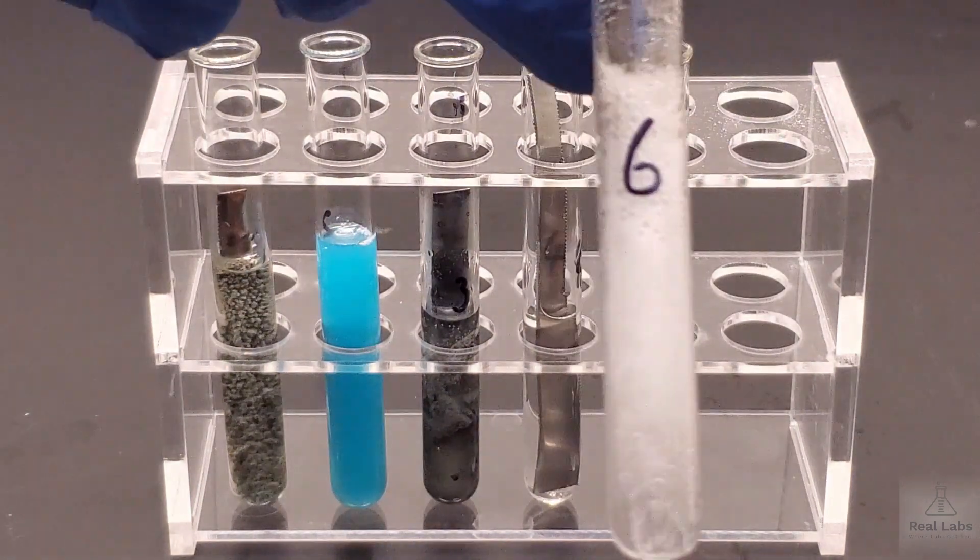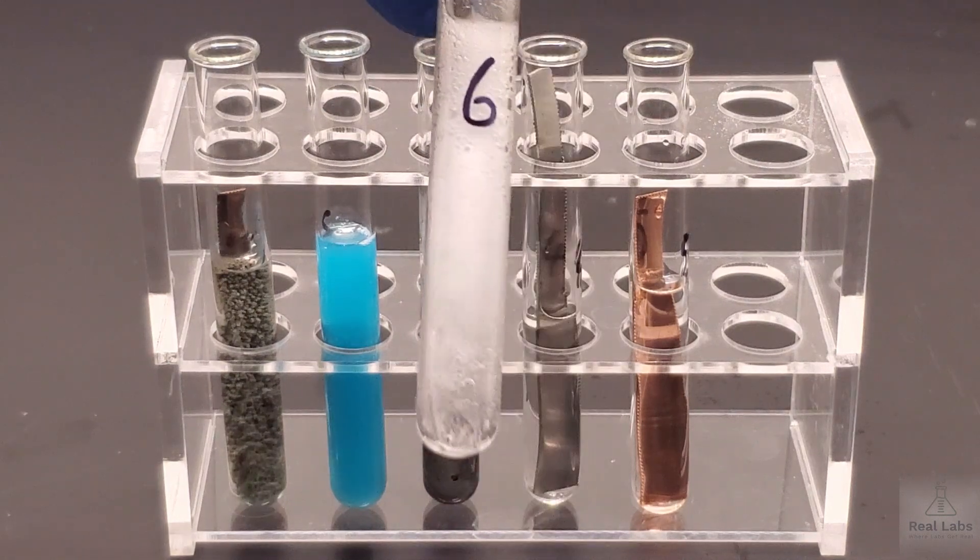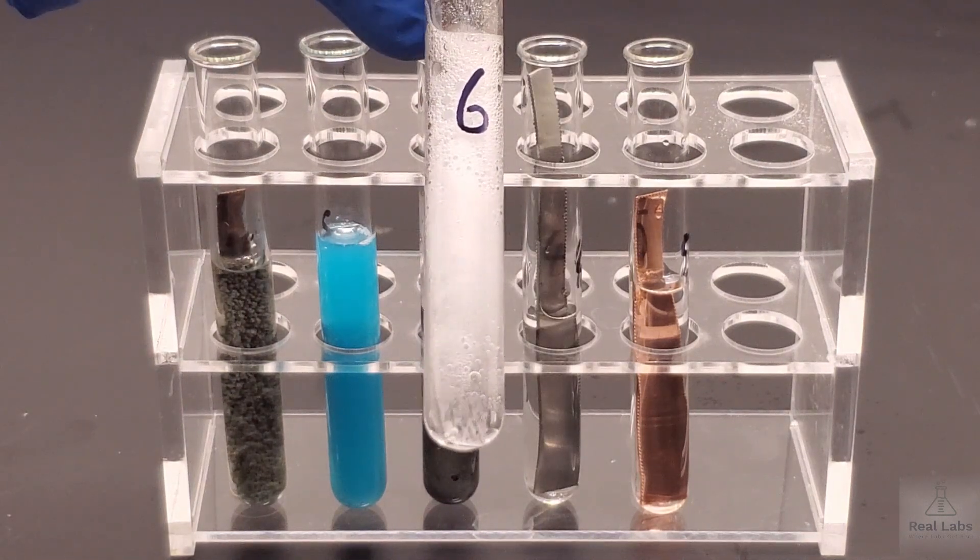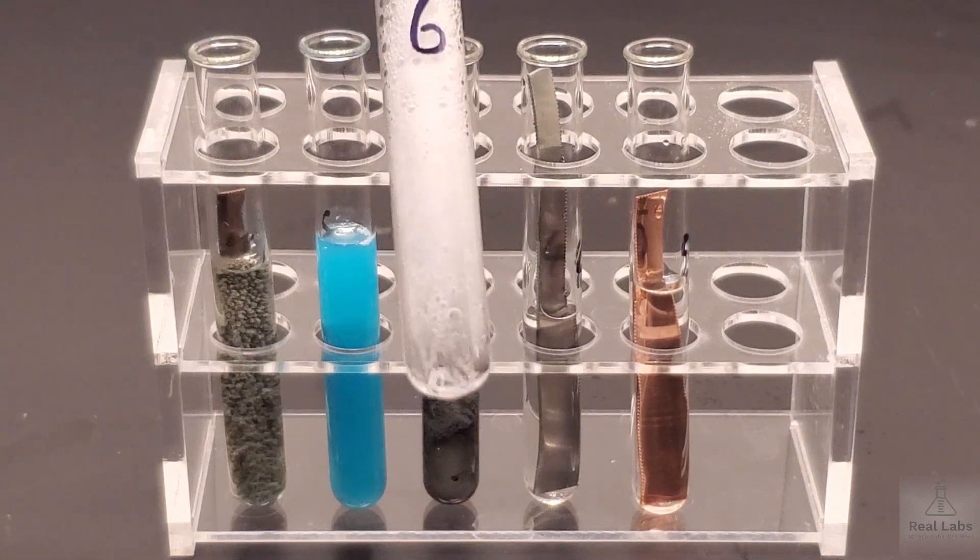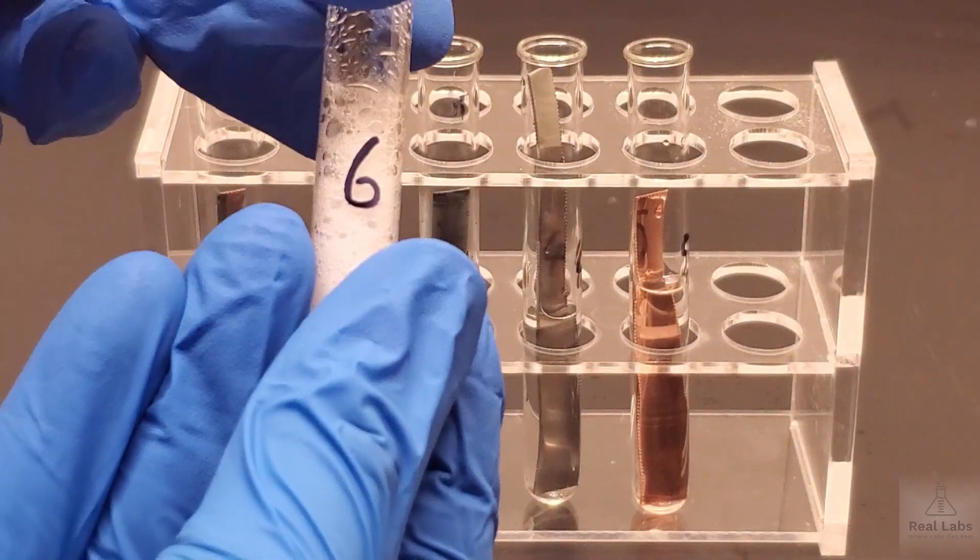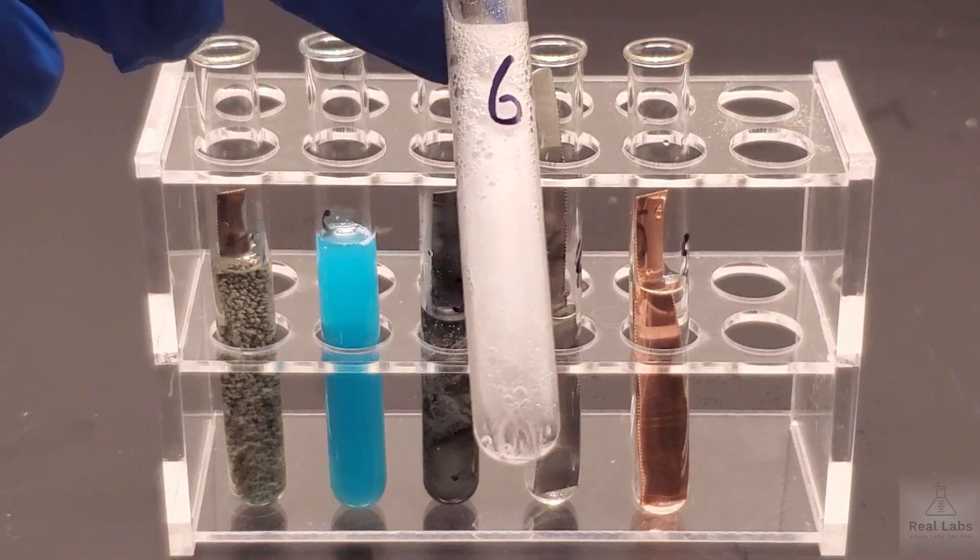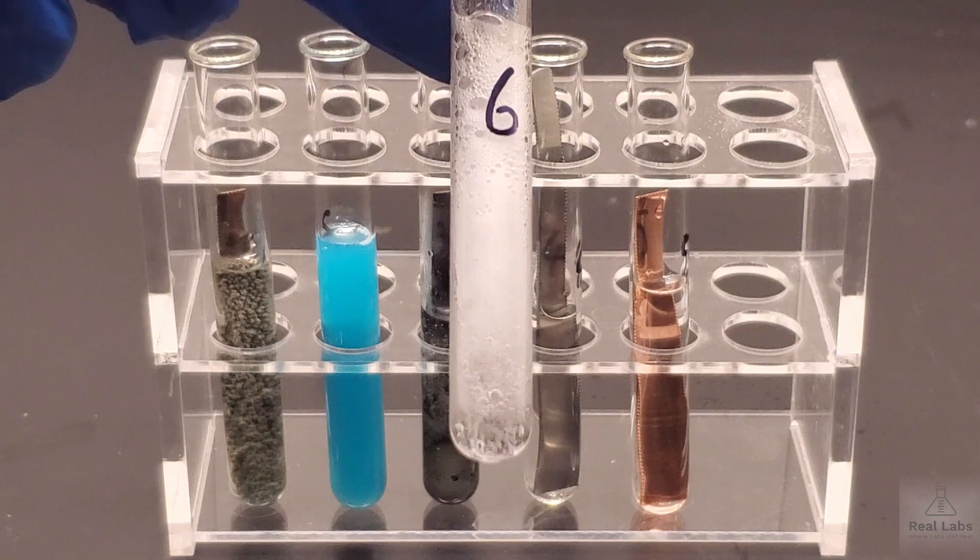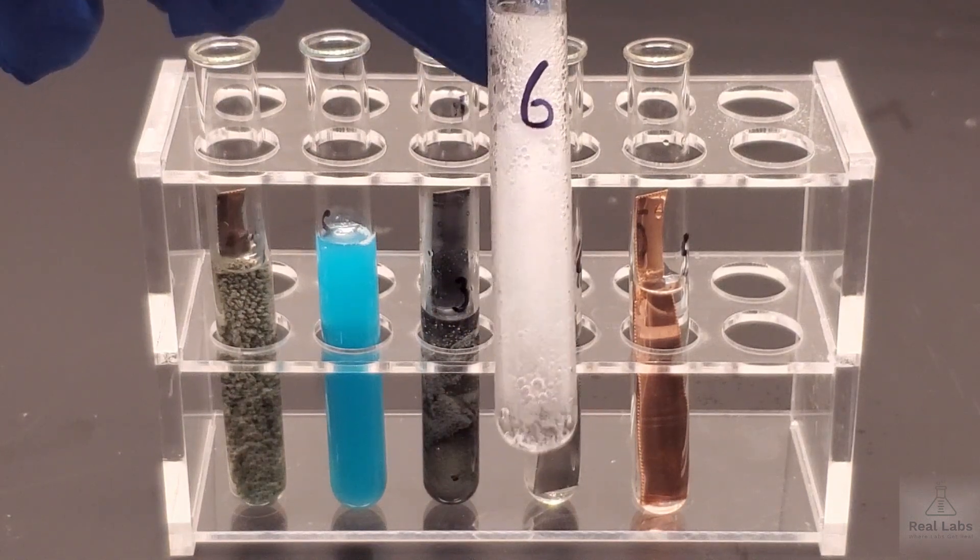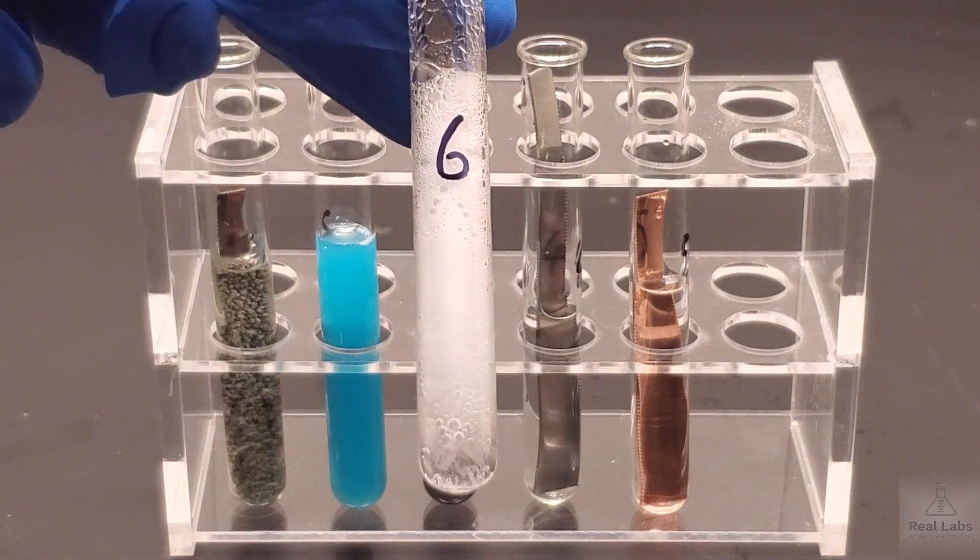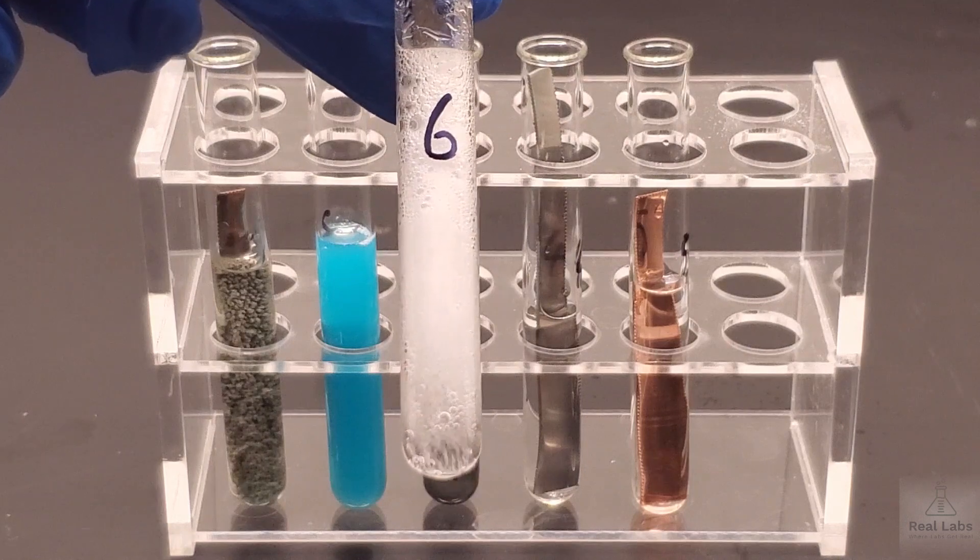And finally, number six, that has been quite busily, clearly doing something the whole time. You can see all those bubbles being generated. It's very clear. And if I just touch it, that's a pretty hot system. Not super super hot, but definitely getting up there. So one of the observations you can make is whether or not there's a change in temperature. Number six is the only one where I can categorically say it felt much warmer than room temperature.